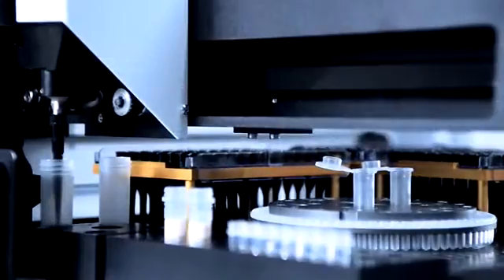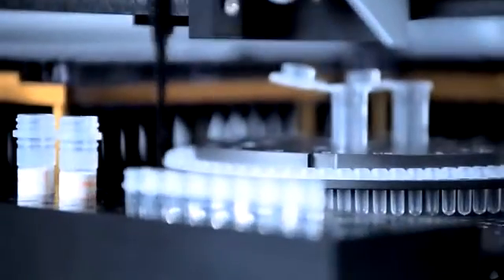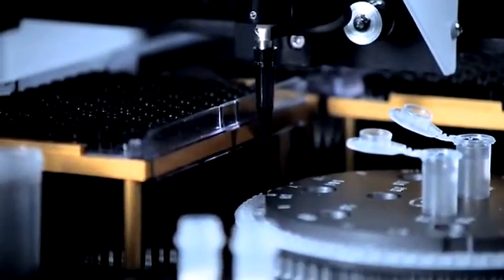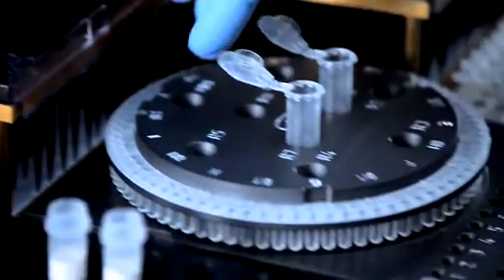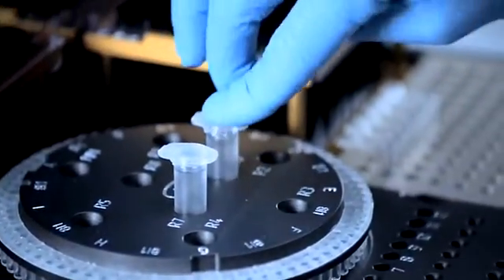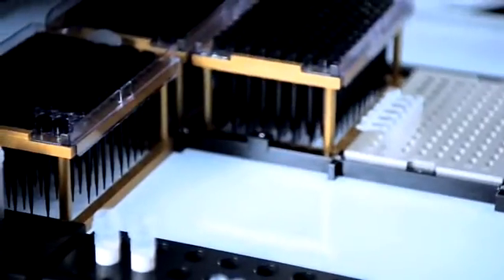The QIAgility worktable is easy to set up and supports all real-time PCR workflows. This versatile system is compatible with all PCR tubes and plates, including rotor discs used on the RotorGene Q.